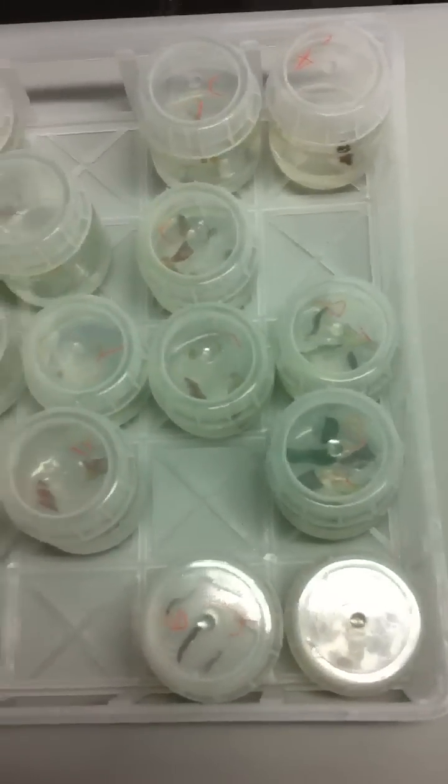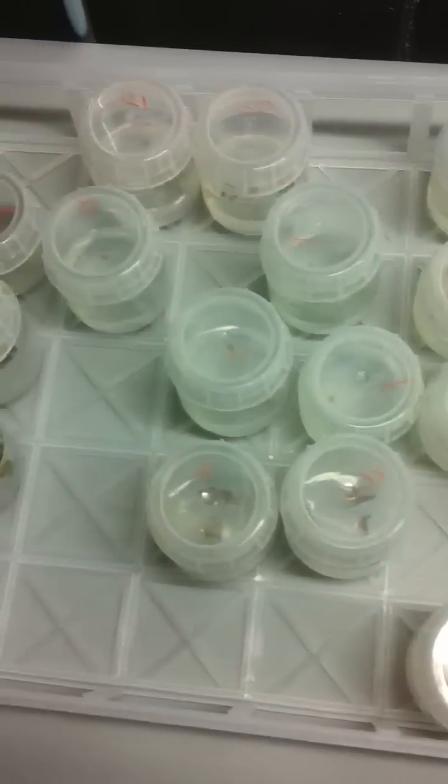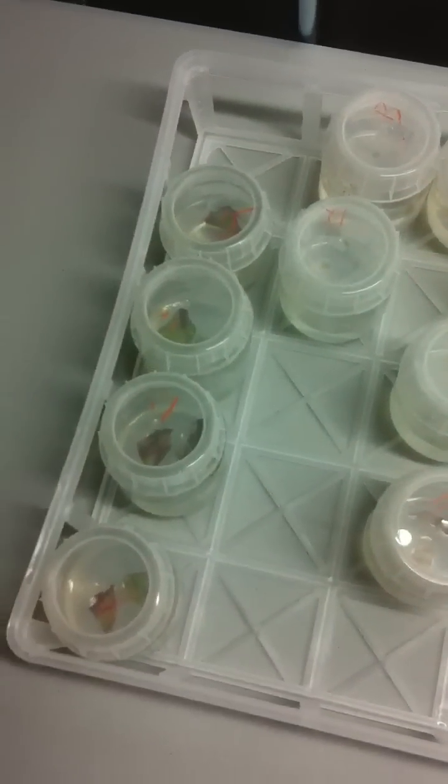Oh! Let me see this thing. The root in there, like all goofily. No, they're not even rooted. They're not? Let me see the bottom of it. It's growing.